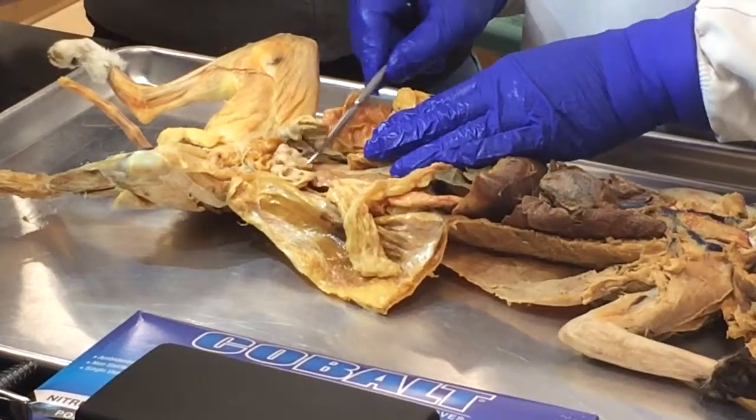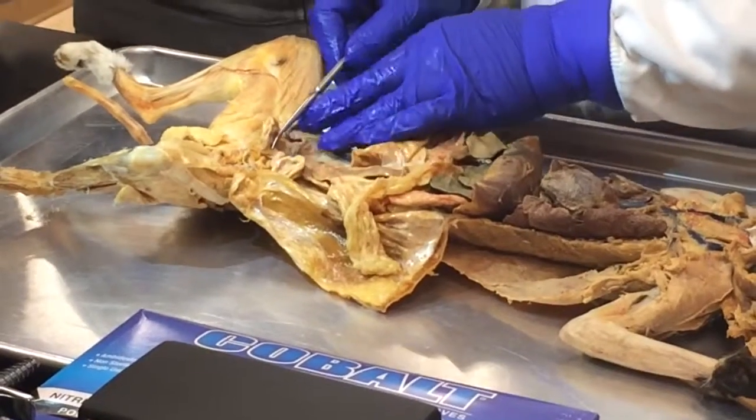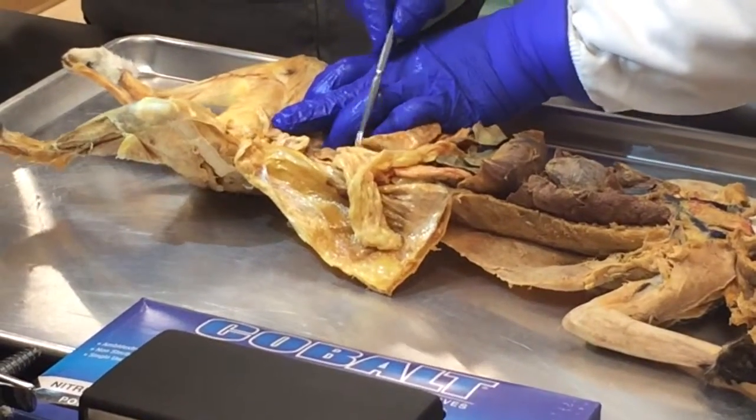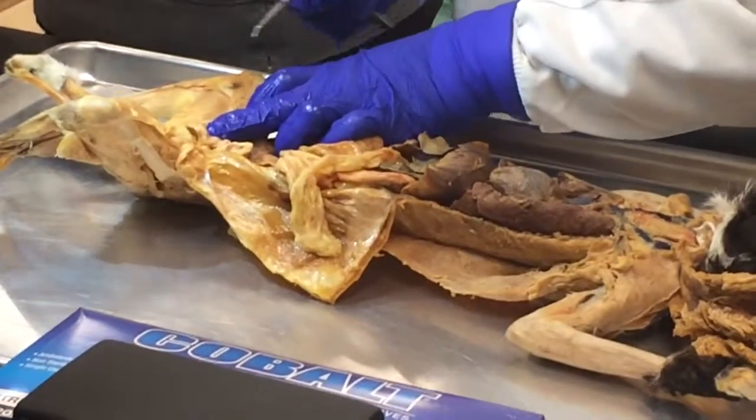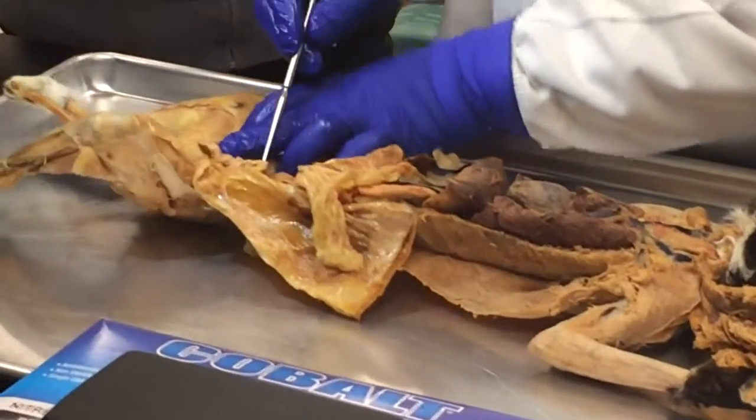You can see there's also poop in here. So this one was about to poop before. Yeah, it's pretty much feces at this point. That's the medical term. Yeah. No, don't say poop in there. You say poop in there. I'll be so ignorant with that sort of terminology.